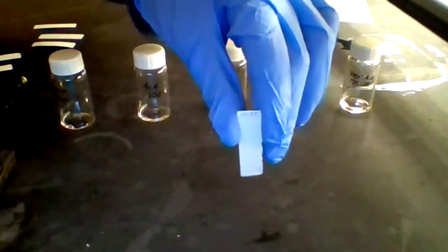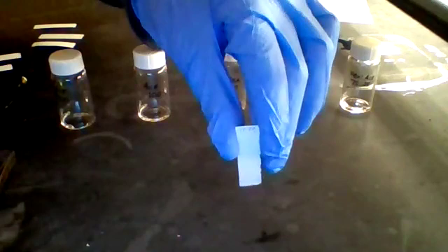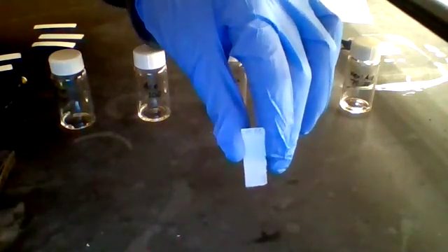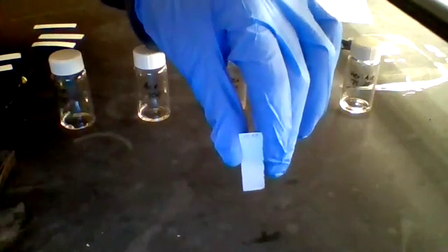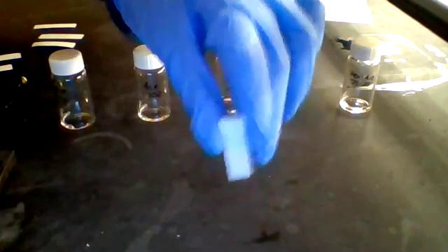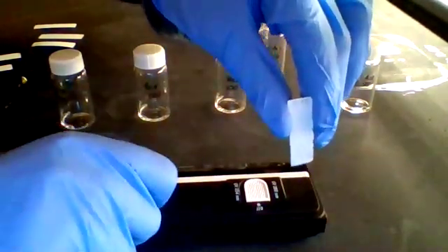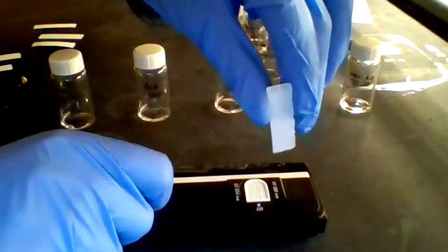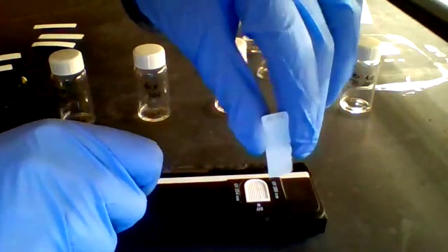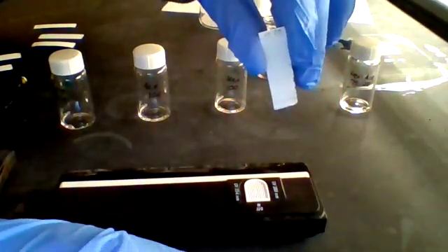And so we did this for all 5 solvent combinations. For part 1, we circled where the spots moved up the TLC plate, if they moved at all. And we've recorded this on the handout that you are looking at. And so what you would want to do is analyze that data, calculate the RF values for the different spots using a ruler, and then we can move on to part 2.